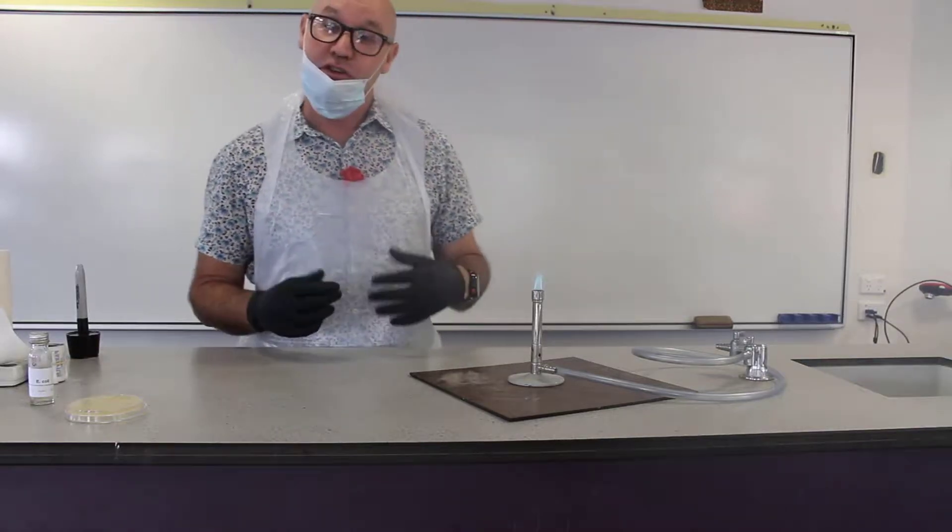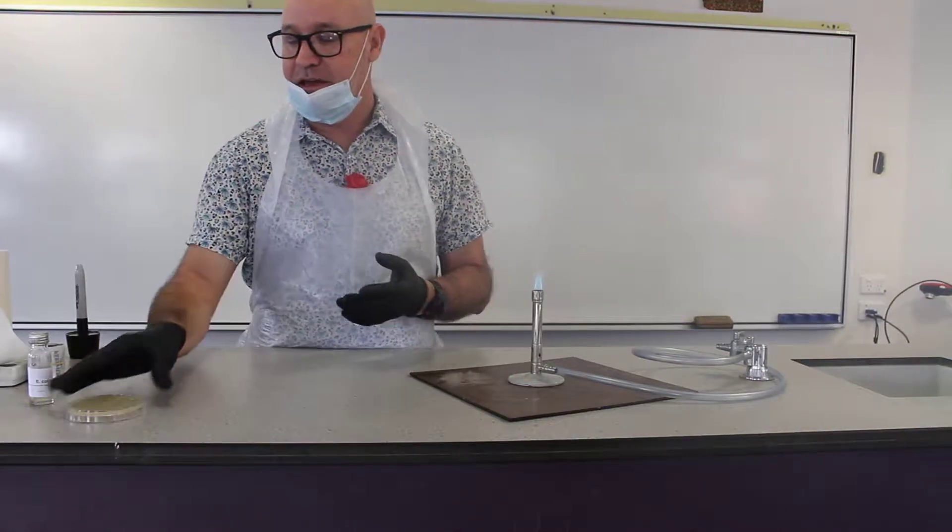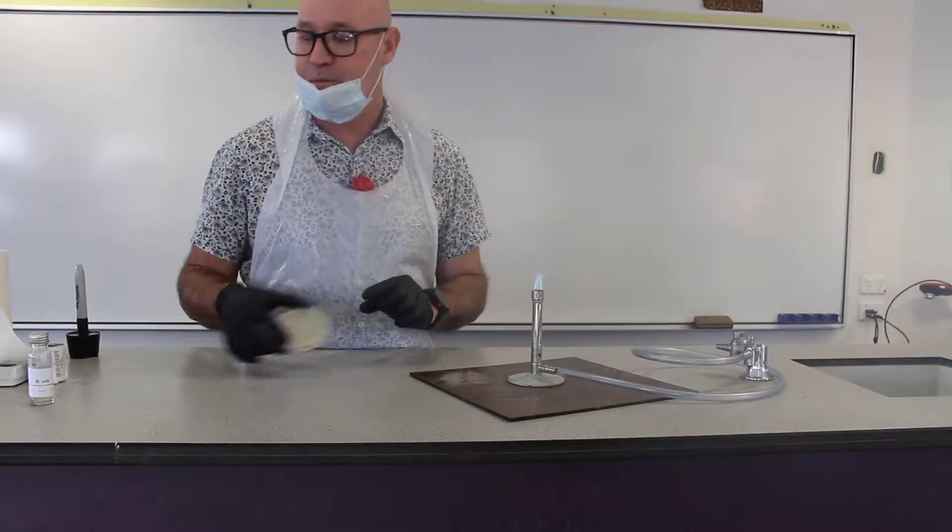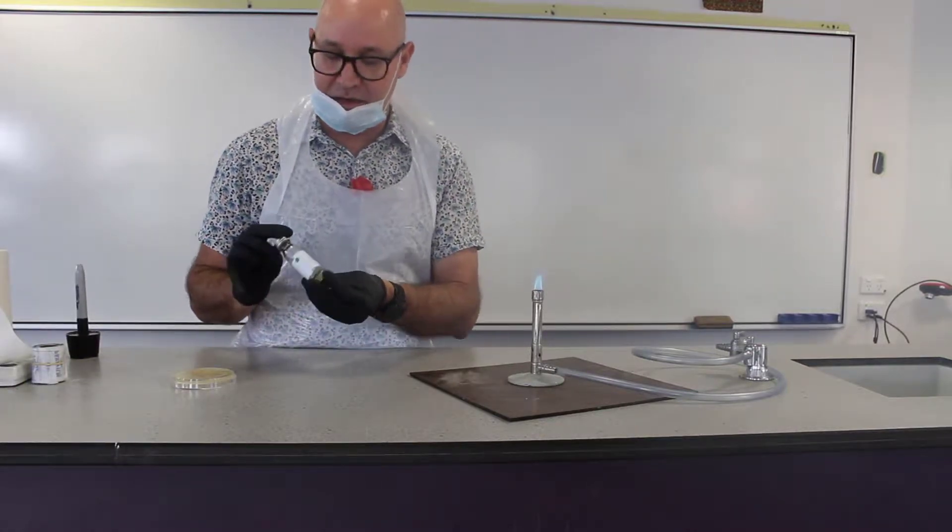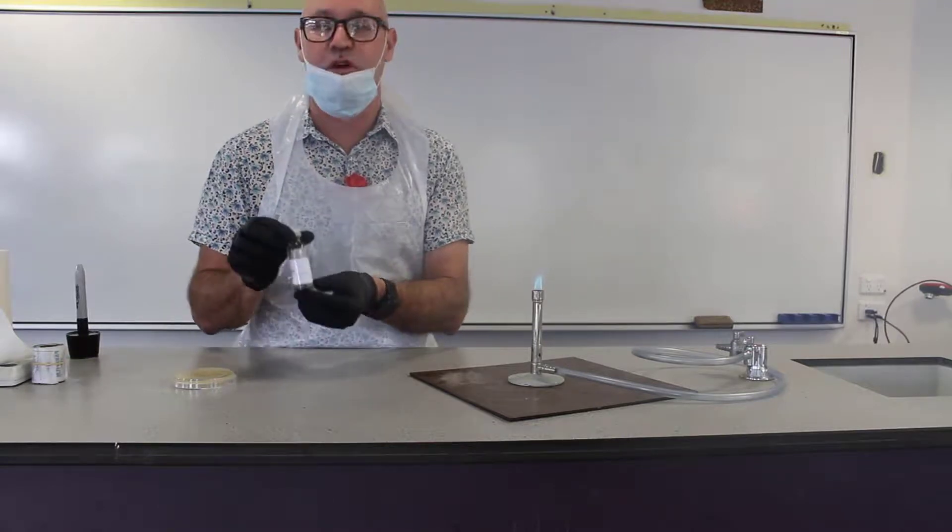Today I'm going to show you how we can use an aseptic technique to inoculate an agar plate with a bacteria that is in a solution or in a broth.